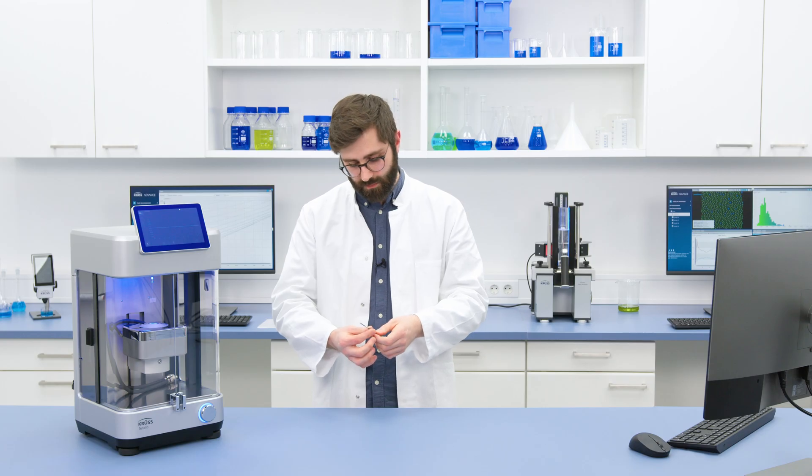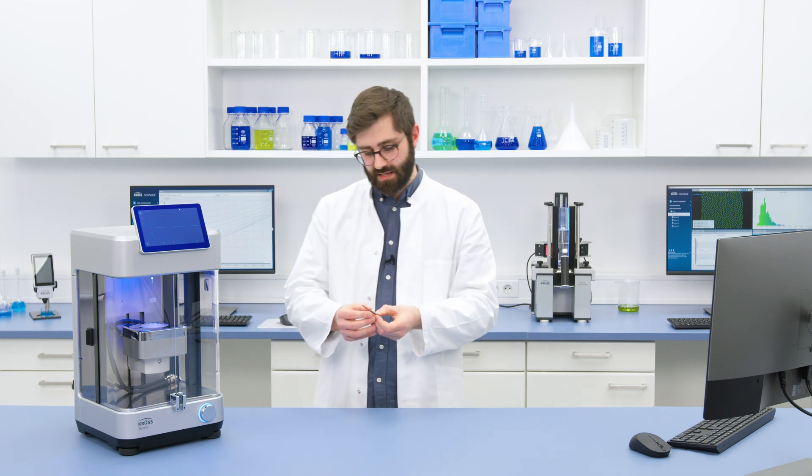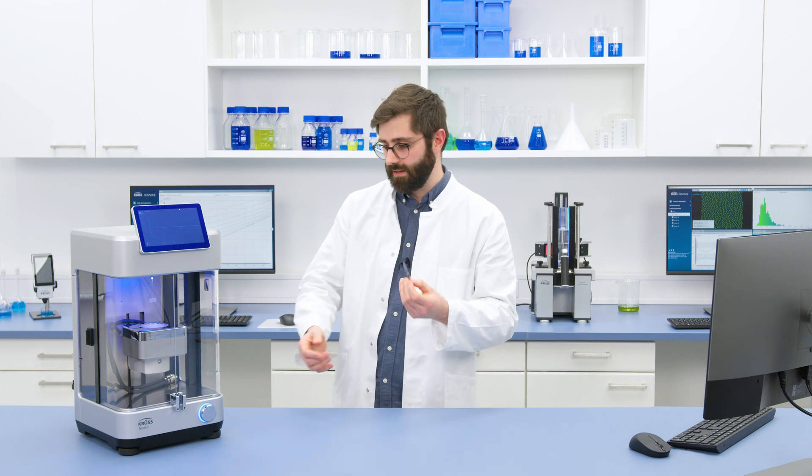If I take something like this sample attachment here—this would normally be used for some kind of solid sample like a plastic or something—here I've attached a small scalpel blade, a knife.